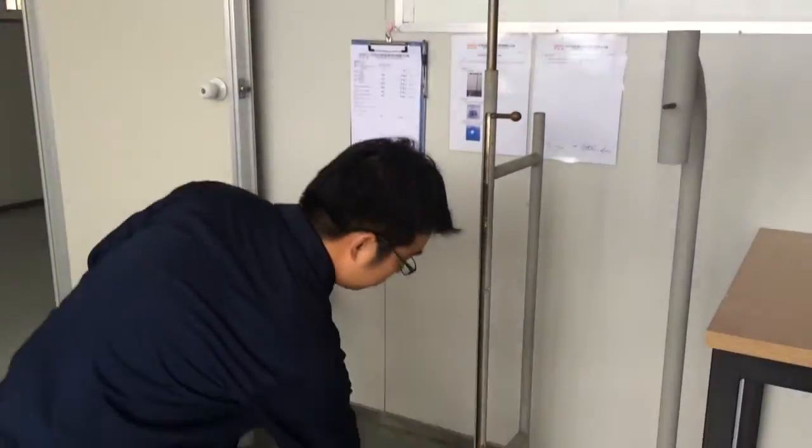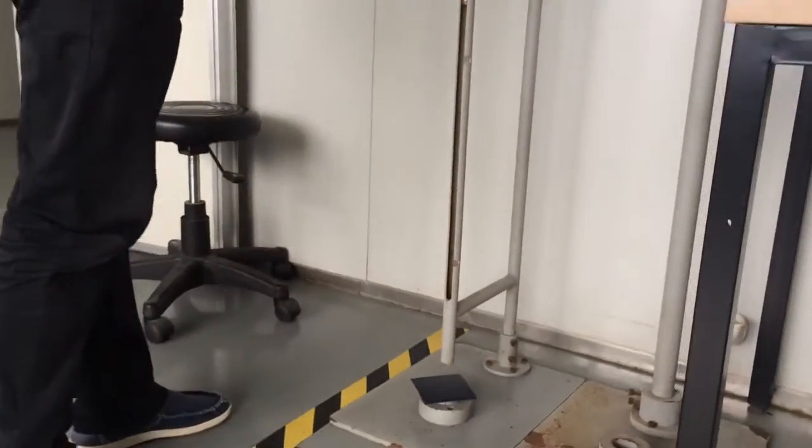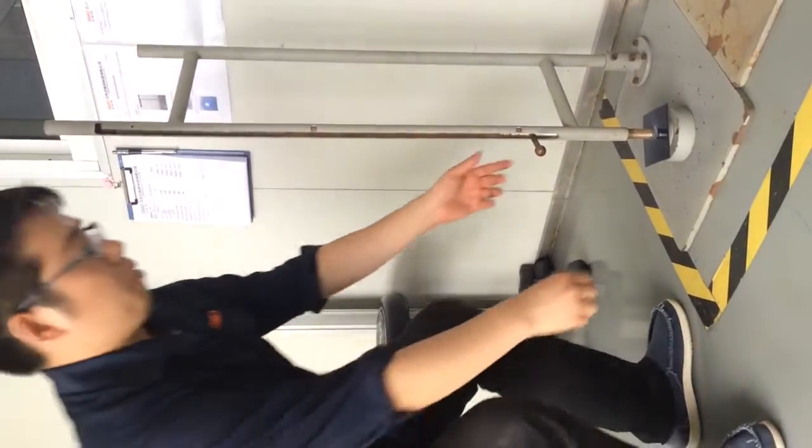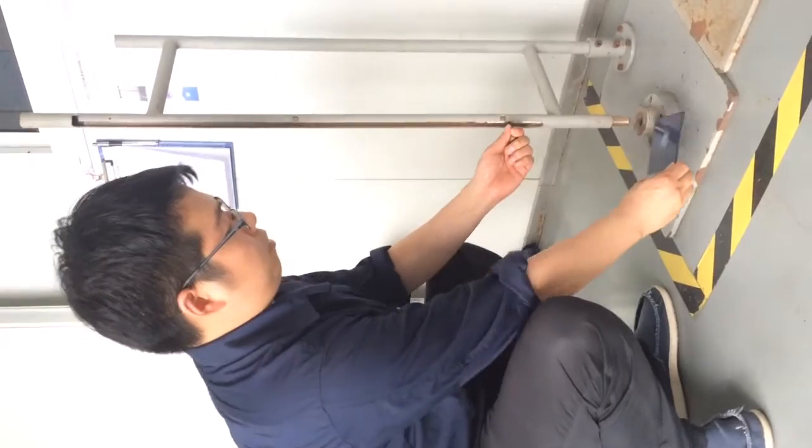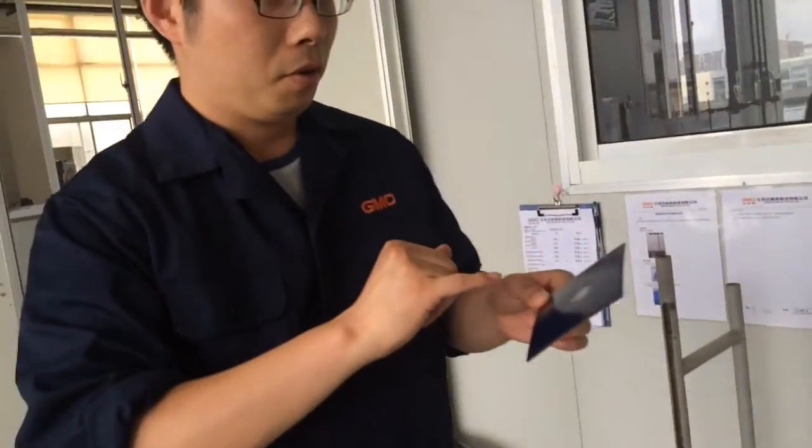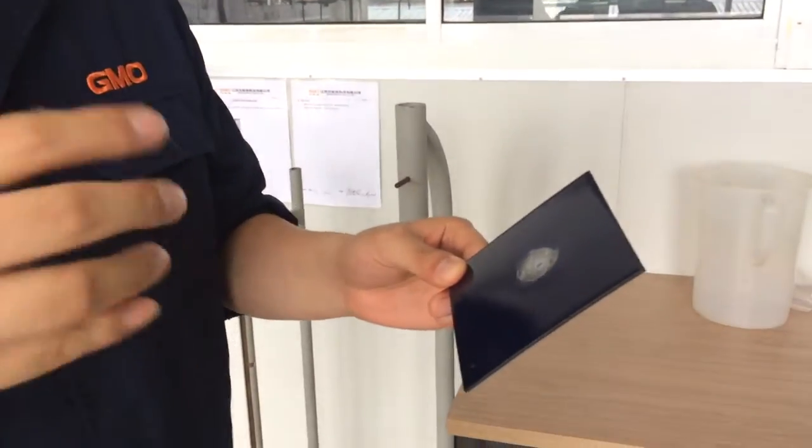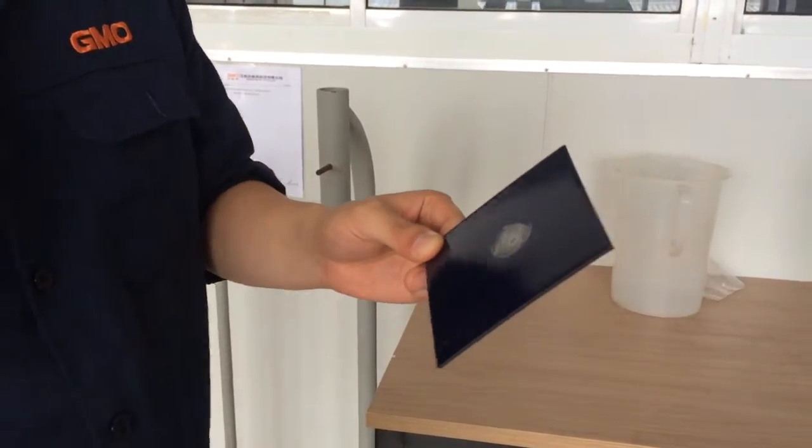I put the sample here and the steel will hit the enamel coating. Now the enamel is still exposed so I wear the glasses. It's okay but if you do this test you need to wear the glasses.